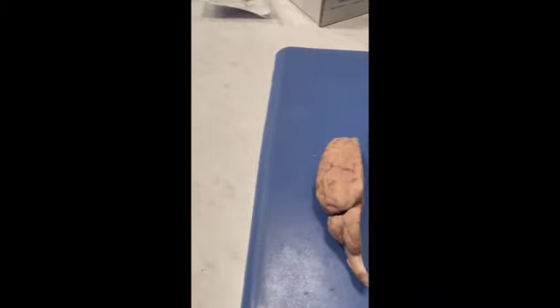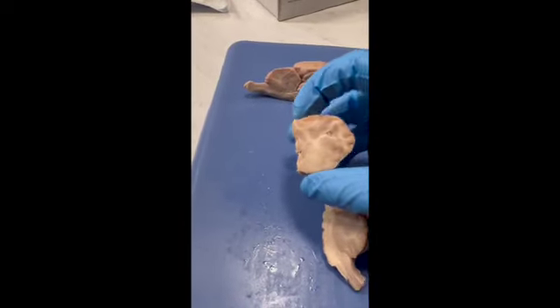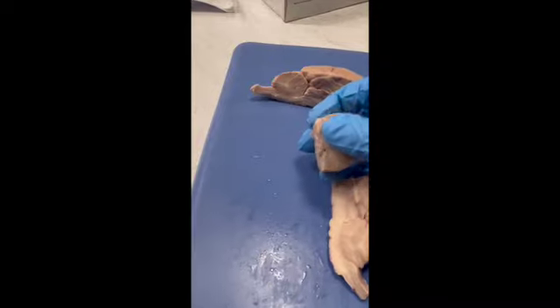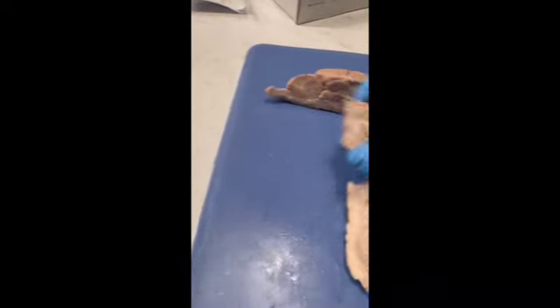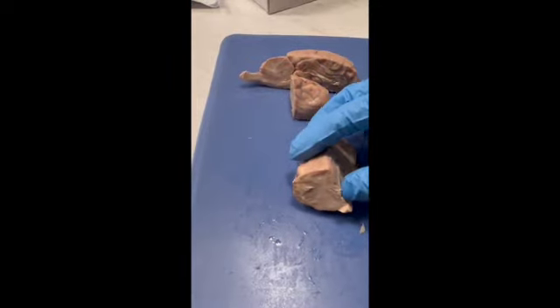And what I thought was really cool was, obviously all of this part, but looking at the cross section, you can see the gray matter versus the white matter and how it's interspersed in the tissues, as well as all of the lines that go throughout.